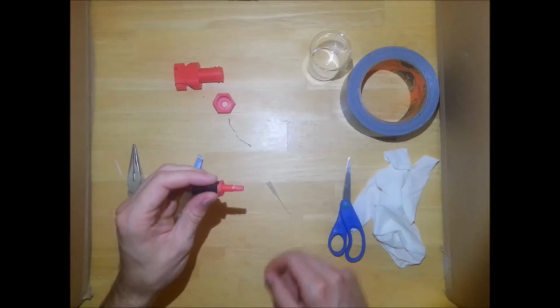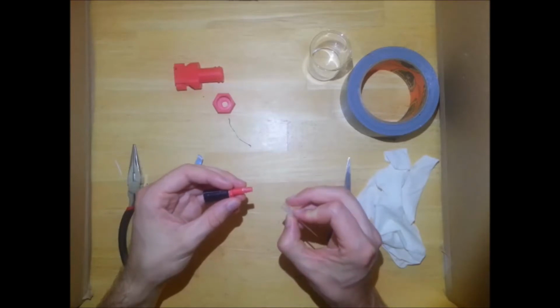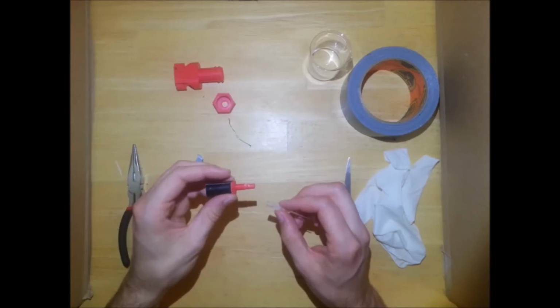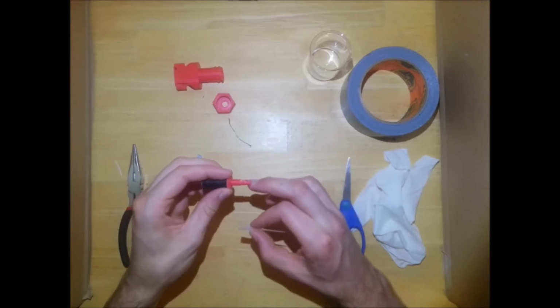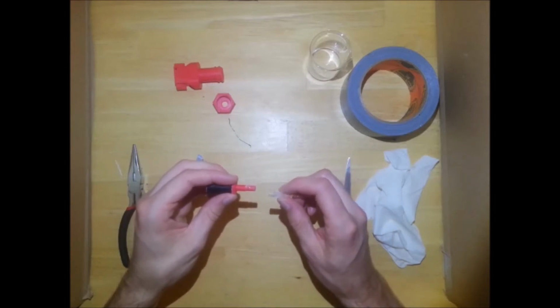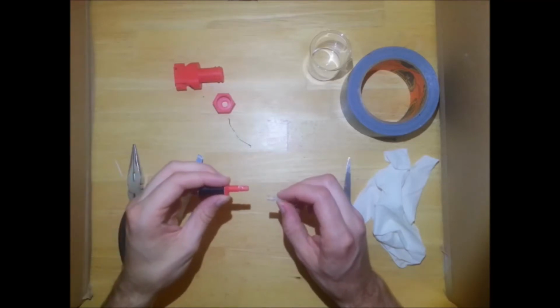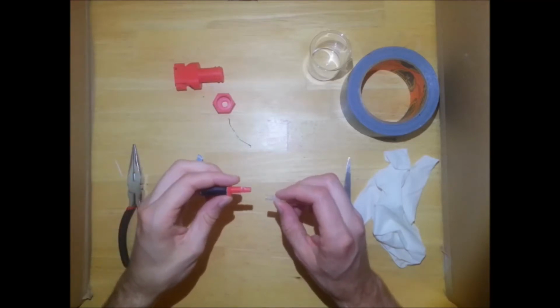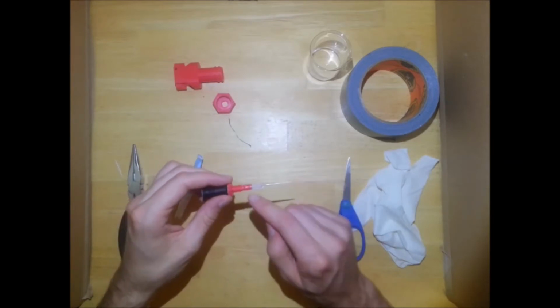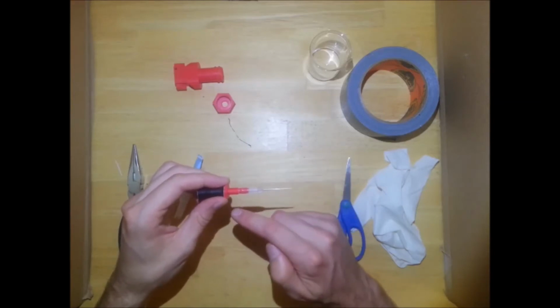So another source of error may be the actual attachment or the interface between your pipette tip and the pipette head. So for all of my pipette heads, I've sanded down this end so that the pipette tip can fit over. And once I do that, I actually super glue the two together. Now, when you super glue the two together, the super glue effectively seals in any cracks between the tip and the head.